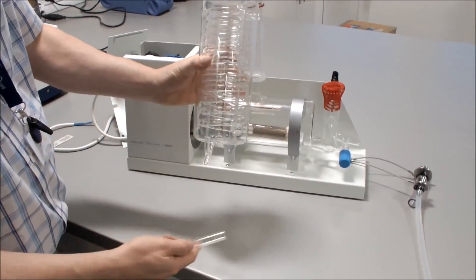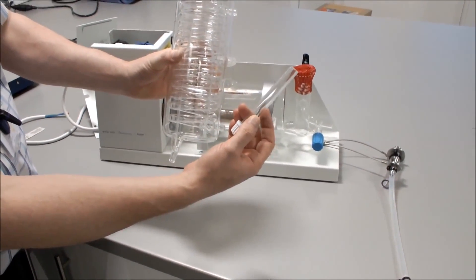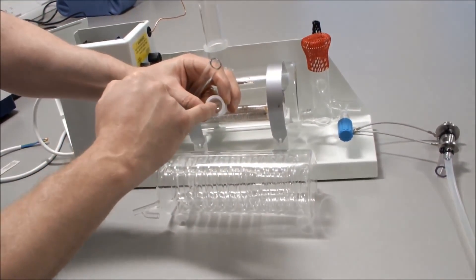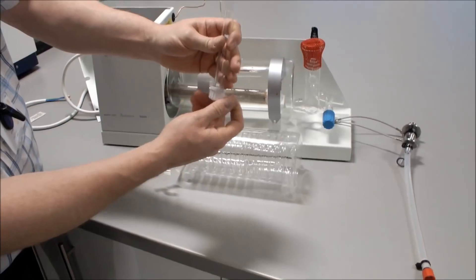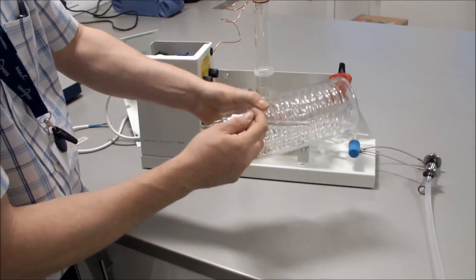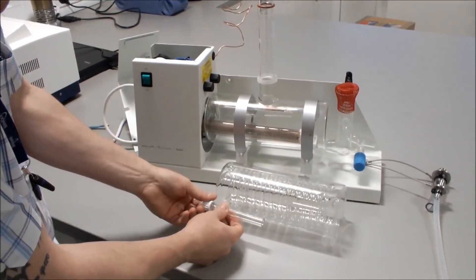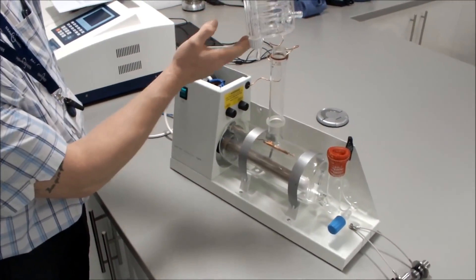Before connecting the condenser onto the vapor tube, we connect the condenser thermostat tube to our condenser. Loosen the white cap — inside is the seal. Ensure the seal fits around the vent and distillate output. Connect it onto there, then connect to the vent and push it on. When that is fitted, tighten up the white screw cap. We then connect our condenser to the vapor tube.